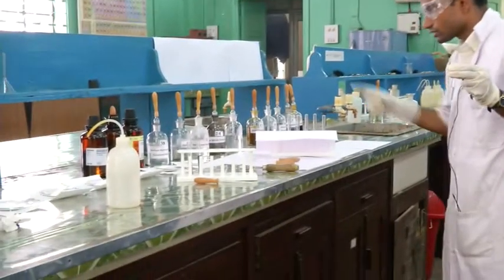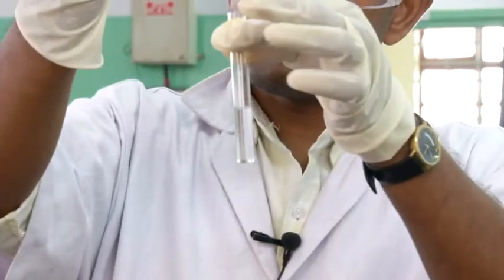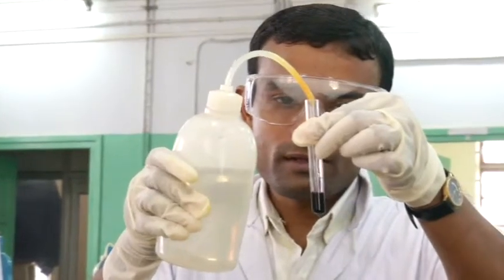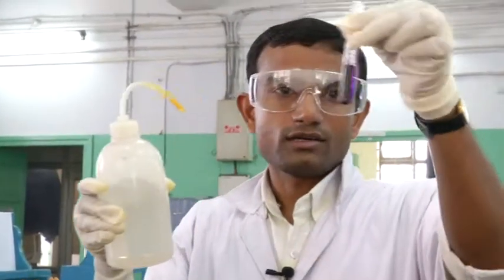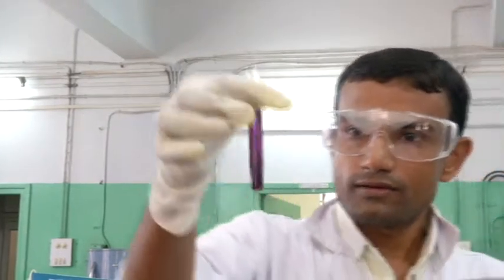I need to check the hydrochloric acid — it is there. Now again I will add ferric chloride solution. You will find a very deep violet coloration. I am adding one drop of ferric chloride solution — can you see a nice violet color? I need to dilute it again. Now I will add some more water. It is a nice violet color, you can see this one. I have diluted it so that you can see it clearly. This is a really nice violet color — you can see it very well.